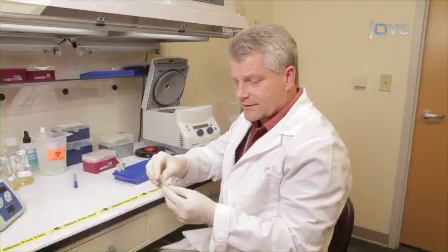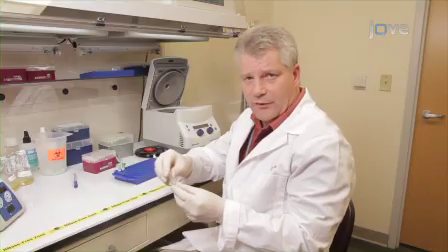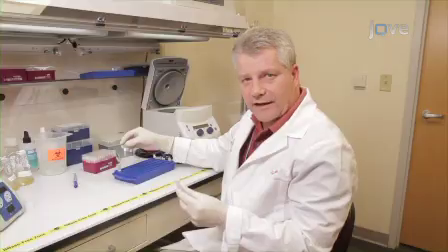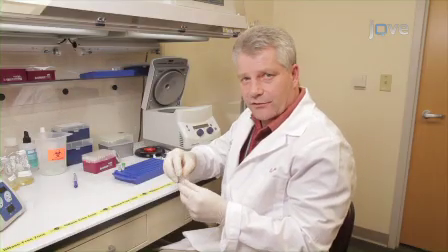One of the most critical steps when you're doing spheroplasting of yeast is to make sure that you actually created 100% spheroplast after the treatment. That means not all lytic enzyme is created equal, so you have to check to make sure good lytic enzyme is giving you good spheroplasting. Meaning you have to take these samples, put them onto a microscope slide, and check under the microscope by adding 0.1% SDS to ensure that you do have protoplast formation.